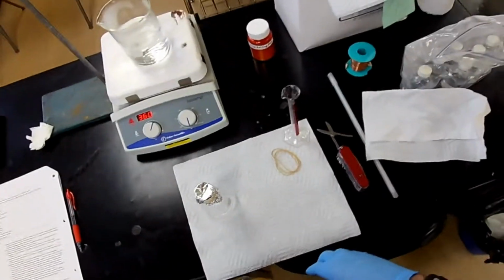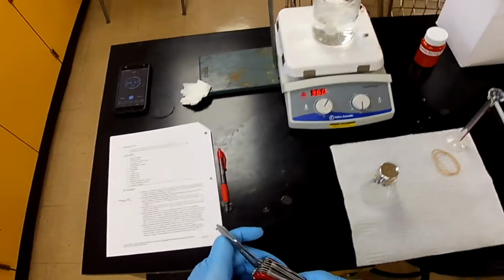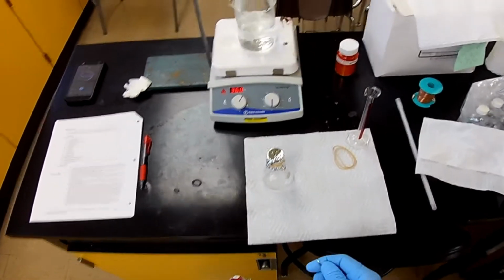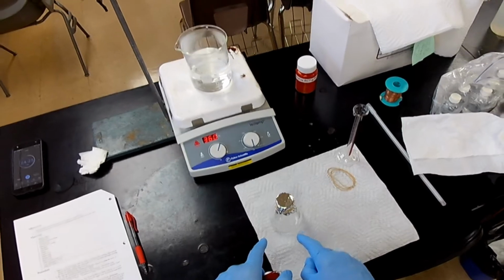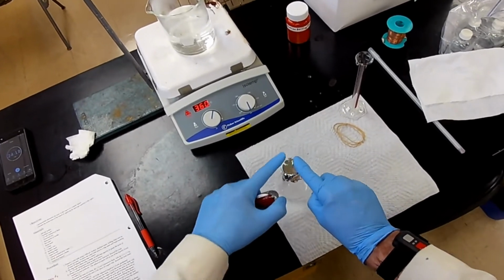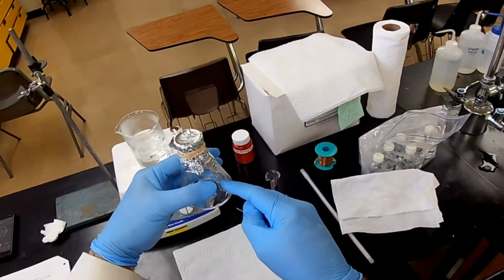Now, how are we going to be sure that we have only gas in there? Well, we need a little pinhole here that's small enough to let the gas out as it evaporates, but not to let any air back in. We want that space completely filled with gas. Right? And we're right down to the edge of the top of the flask, so that's why we need to measure the volume of this after we're finished.